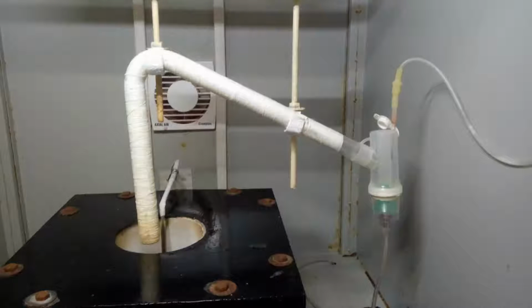The nebulizer used here is a simple nebulizer of the adult oxygen mask, which is used for therapeutic applications. Here, the guiding tube is programmed to scan the substrate using the linear slide and the limiting switches. After some programmed number of scans, the substrates are made to rotate by a particular angle with another stepper motor to which the substrate holder is attached.